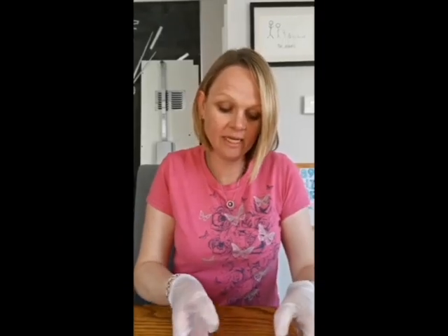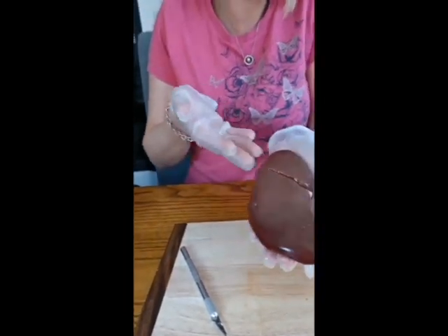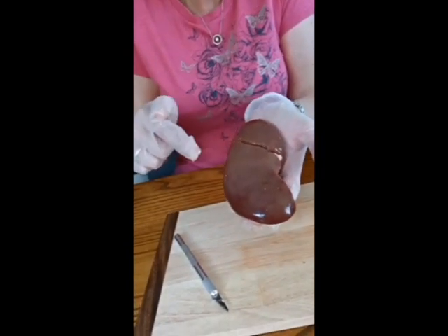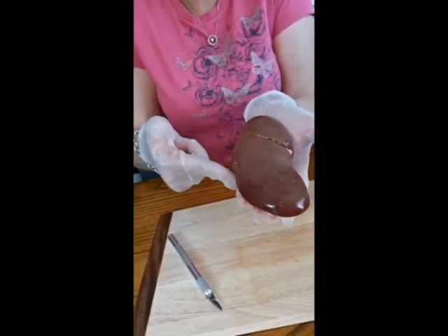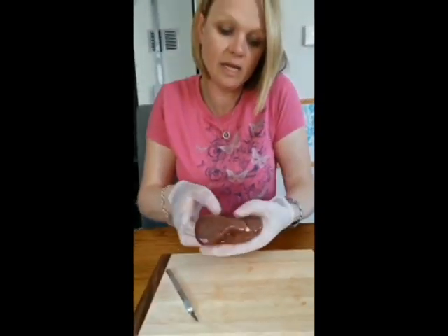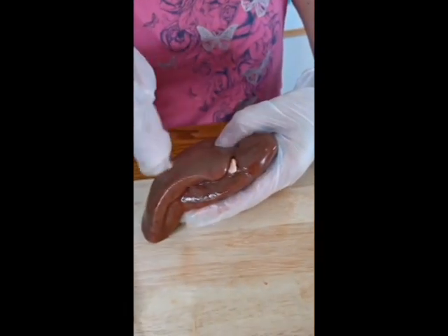Right, so this one here, I've already shown it before, it's the kidney. Now, you know why kidney beans are called kidney beans now, because of the shape of them, so it's got the same kind of shape. When you dissect, you cut along this edge and open it up like a book. This bit here that you can see here, this is actually called the ureter. So this connects the kidney to the bladder.